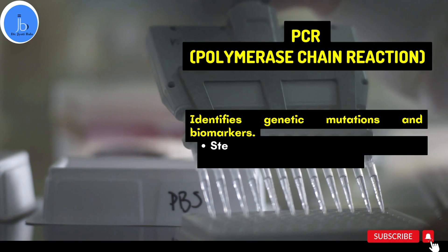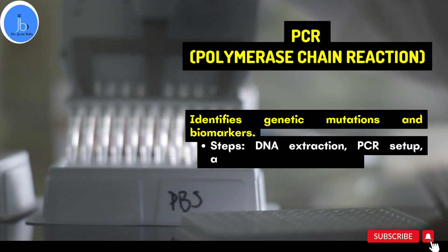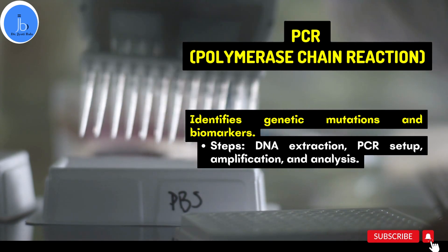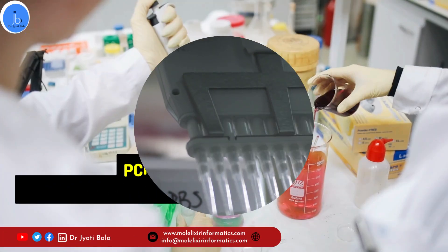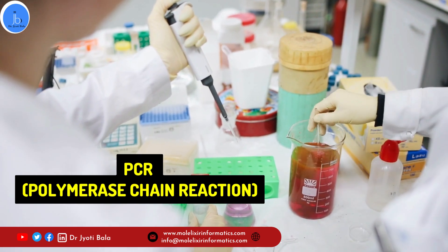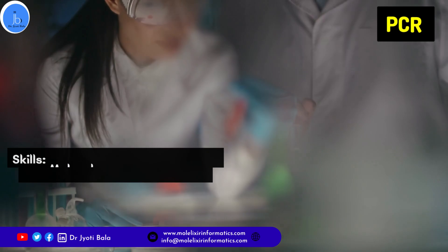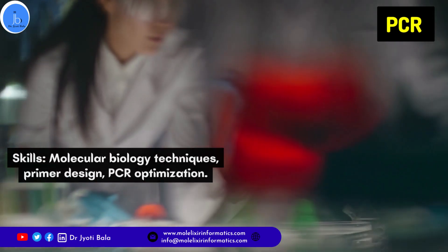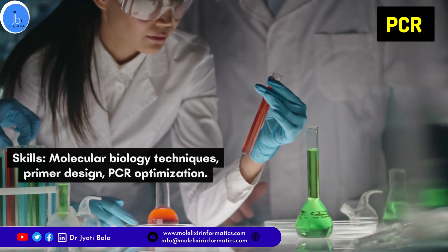For performing PCR, you require template DNA, and sometimes you also have to extract these DNA samples. You then need to set your PCR, amplify your template with chosen primers, and do the required analysis. The skills required are molecular biology techniques, primer designing, foundation knowledge in bioinformatics, PCR optimization and standardization, and it is also good if you know how to run gel electrophoresis.